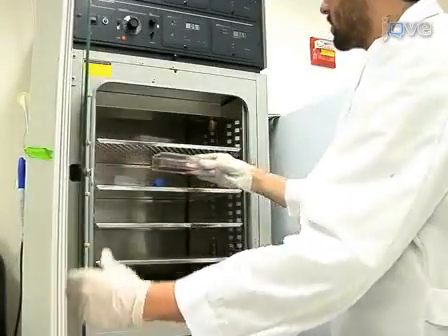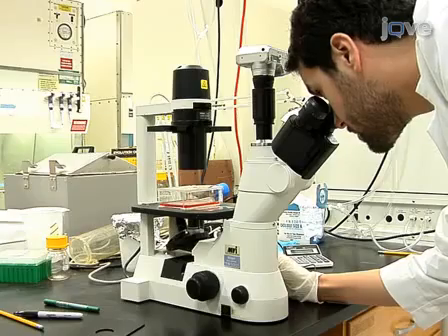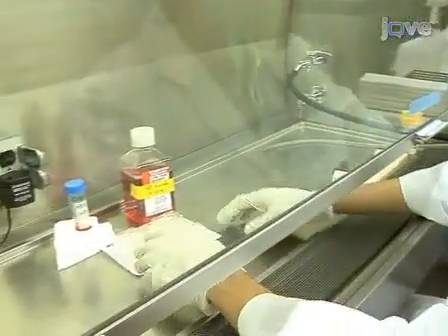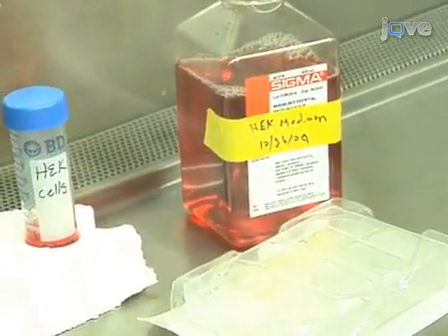One day in advance of the experiment, prepare cells and substrates for use on the following day. Cell types and media will vary, but if experimental cells are not strongly adherent, use an appropriate cell adhesion substrate, such as poly-D-lysine-coated tissue culture plates.